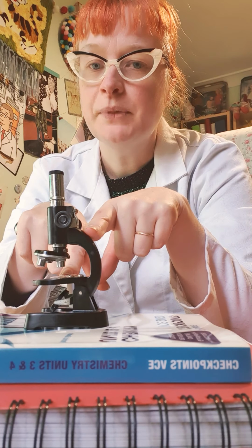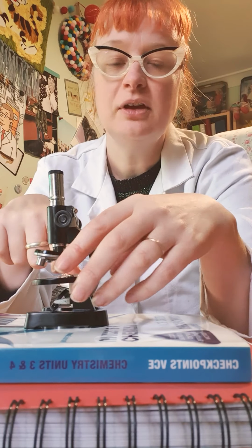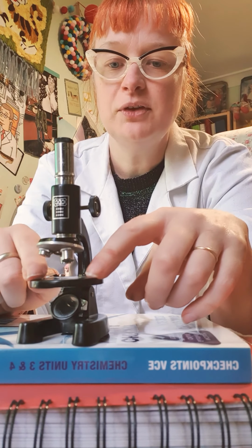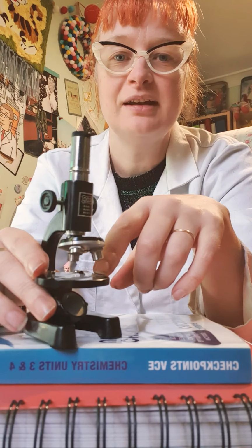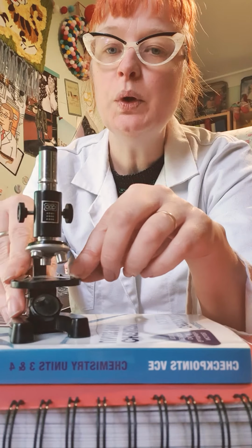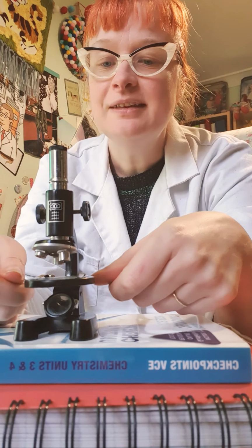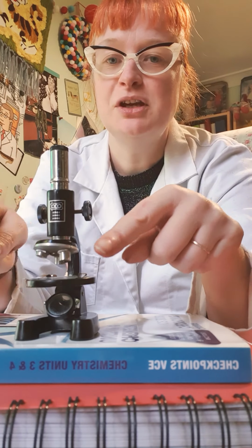If you're not sure and you can't find something, so you might have just one flea on this whole slide, what you can do is you can just move this around. You can just move your slide, and either you can move it like this, if it's just like the bog standard kind of ones we have, you just move it around by hand gently, or what you can do if we have the fancy ones is they move around. They have little knobs either side, and you can move them backwards and forwards, and it kind of moves the stage without you having to use your fingers.